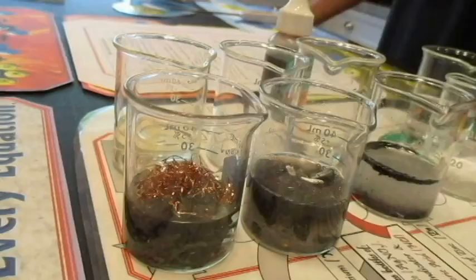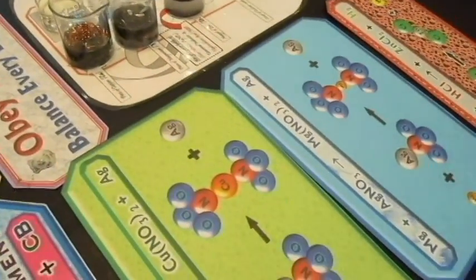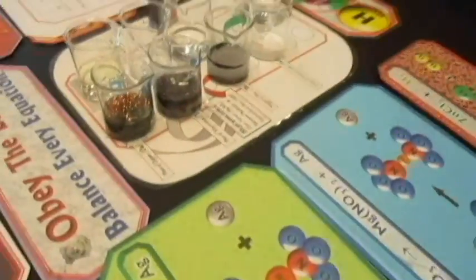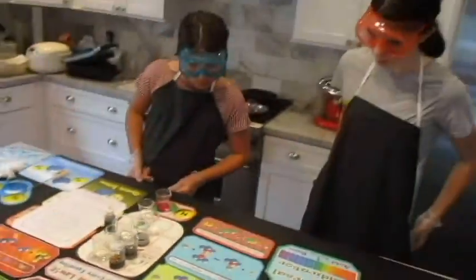It came out of the silver nitrate. Yeah. So look at these reactions. What gets kicked out of the silver nitrate? What gets kicked out of the silver nitrate? What has that gray color? What do you think? Any guesses?